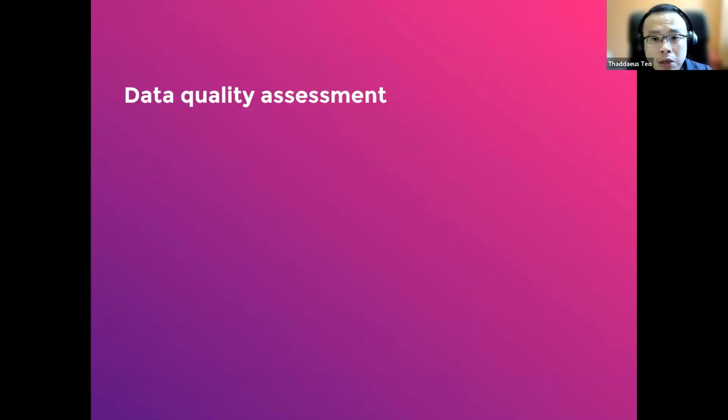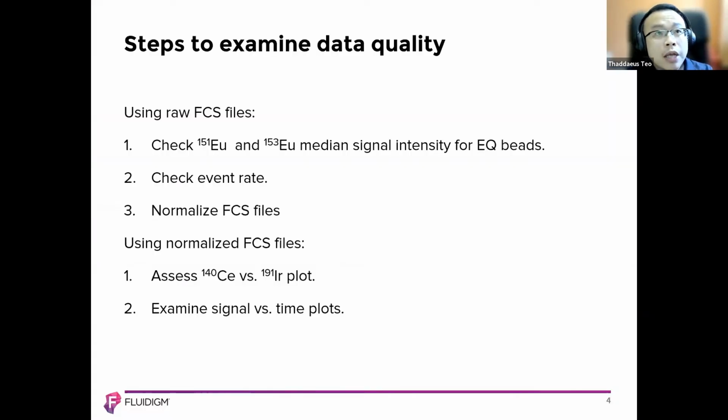So now let us begin with the data quality assessment. This should always be the first step before we commence any cleanup and population gating. From there, we can scrutinize if the acquired sample is good for in-depth analysis. At this point, there are a couple of steps to go through. You can see that we will begin with the raw FCS file. We will check 151 Eu and then 153 Eu median signal intensity for EQ beads.